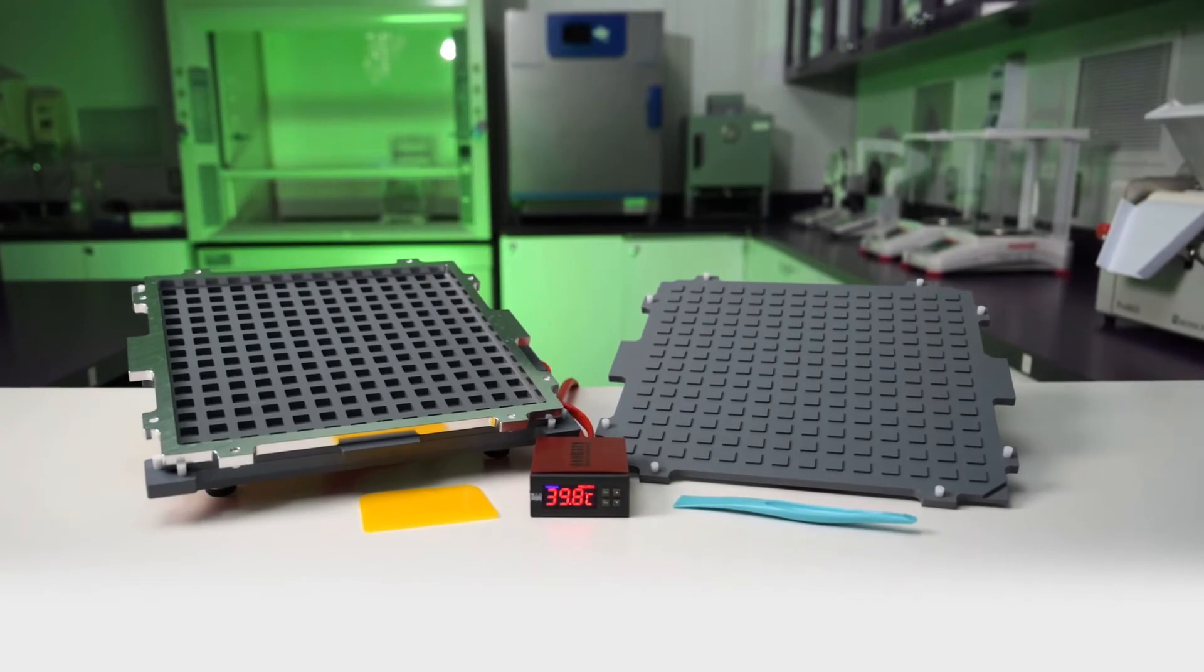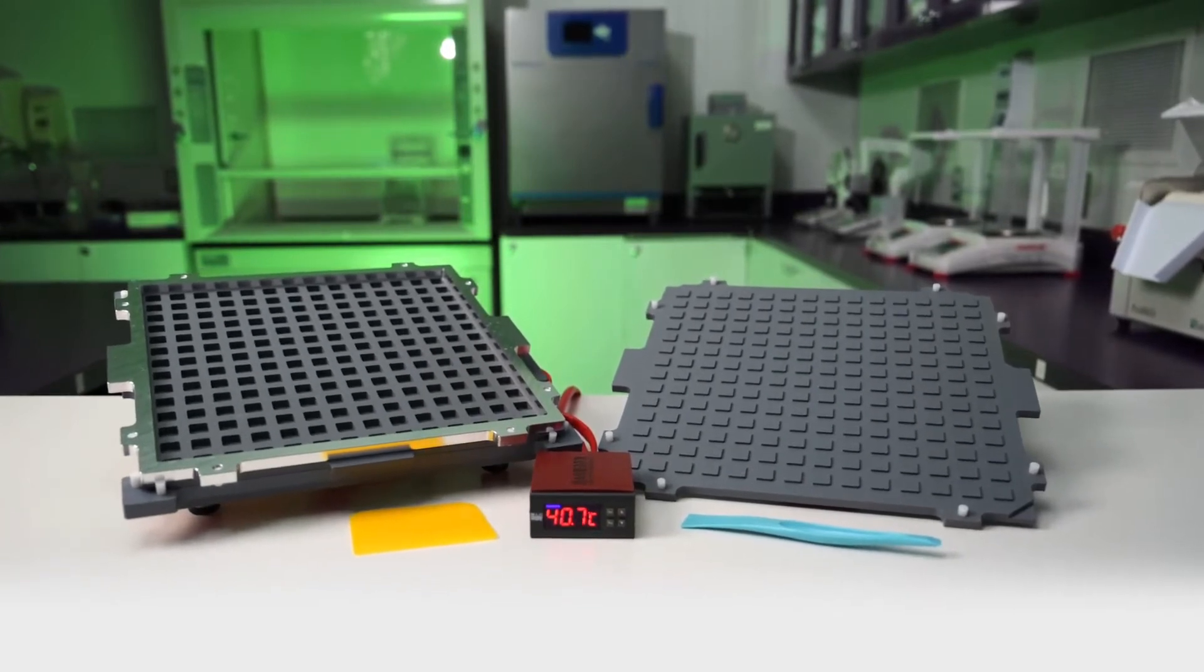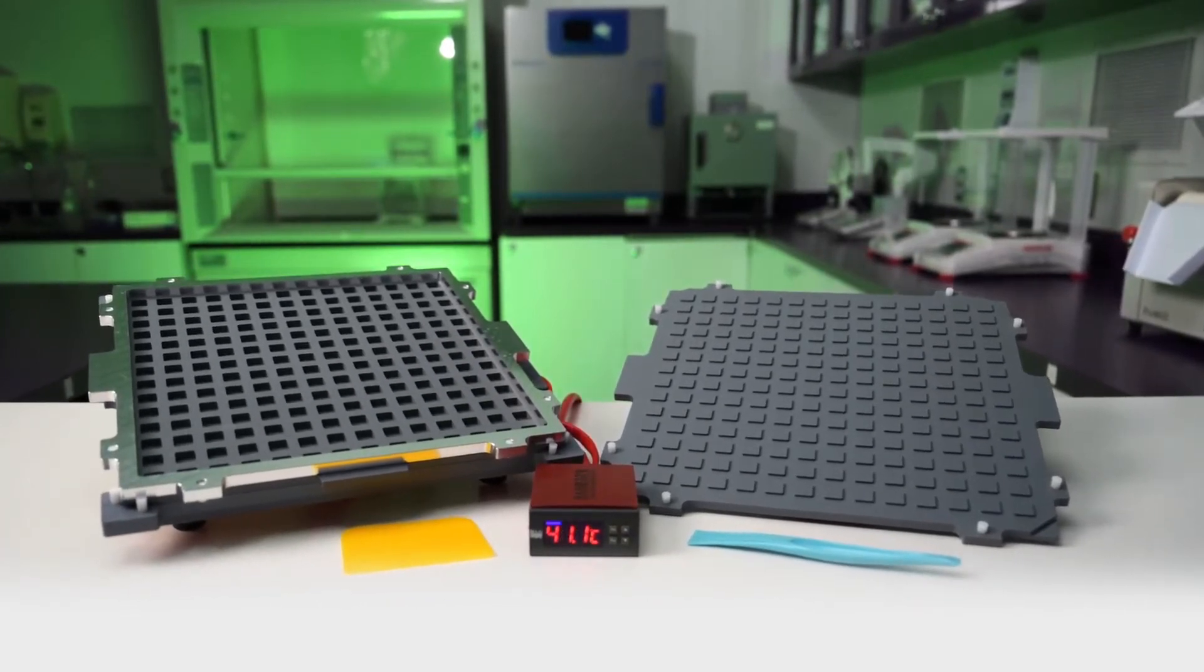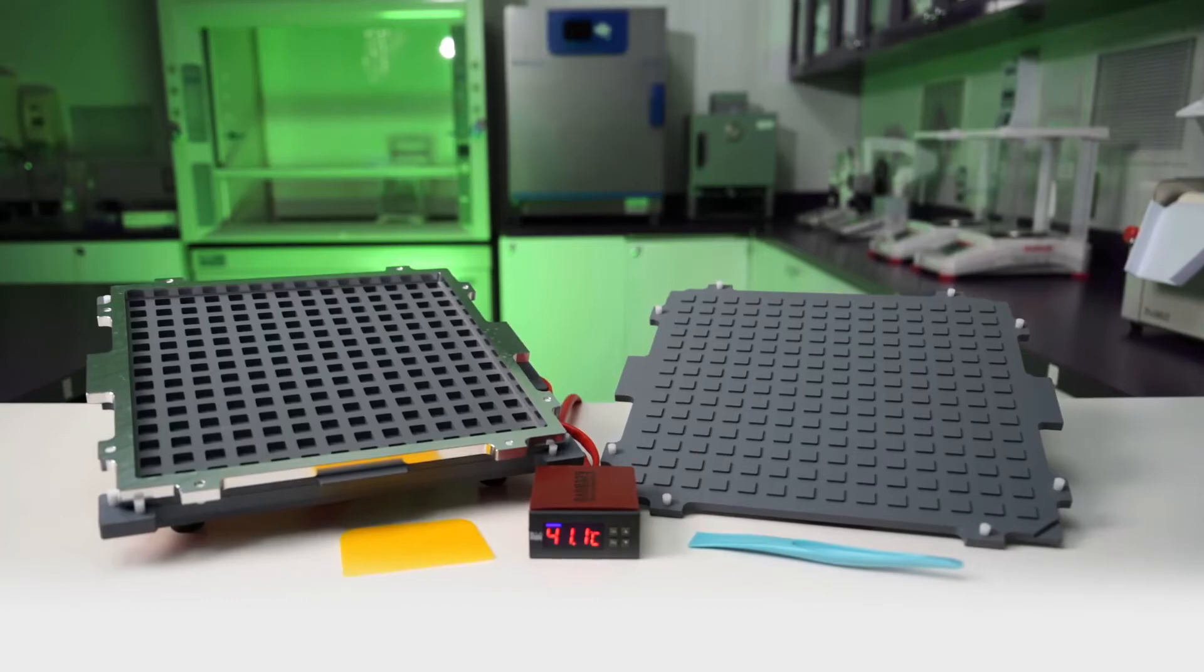In this video, you will receive step-by-step instructions on how to use Medisca's Medi-X-Tab mold. Let's get started.